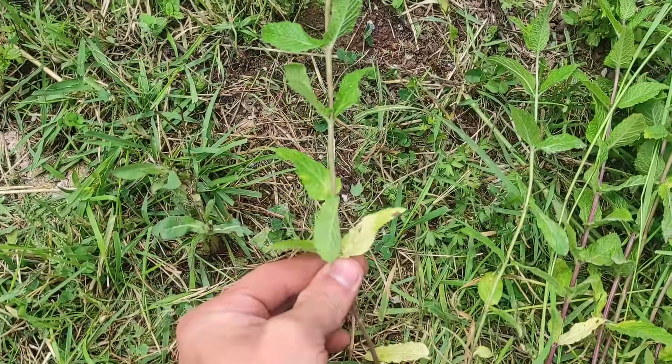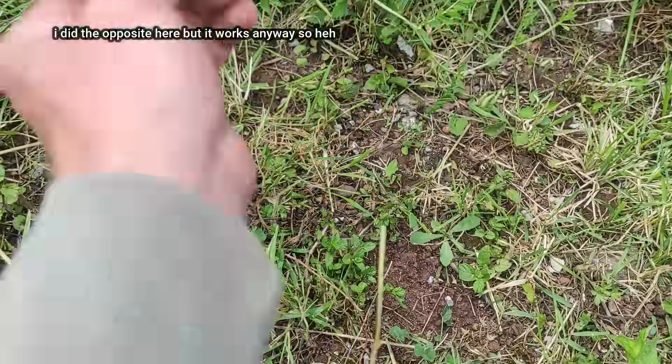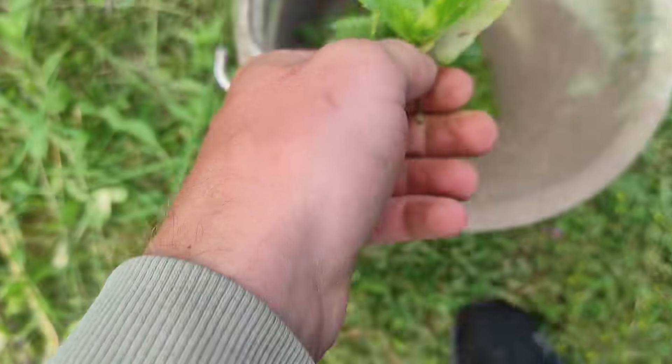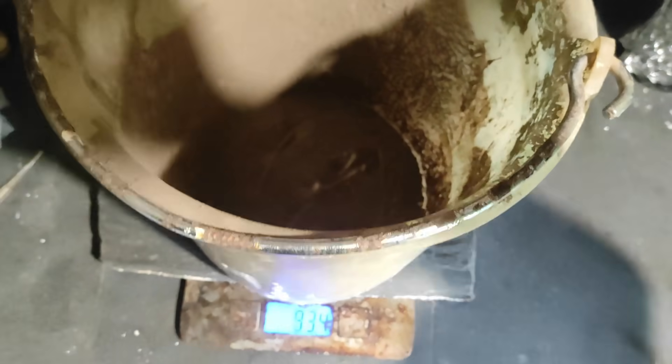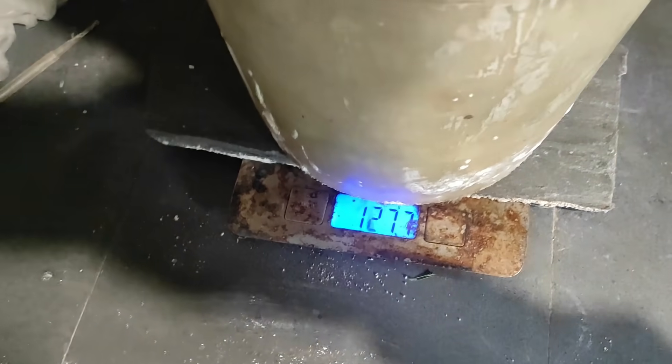So what we're trying to do is separate most of the stems to be left with more leaves. You can trim the leaves with your hands from the top of the stem to the bottom — this way the leaves get separated more easily. Then I chopped the leaves a little bit and weighed them. The bucket is about 900 grams, and with the mint the total is 1200, so we should have approximately 300 grams of peppermint leaves.